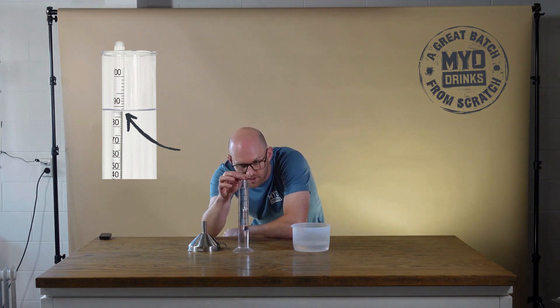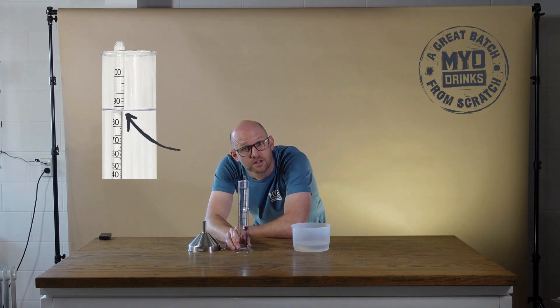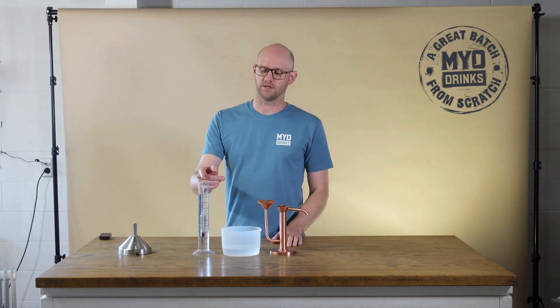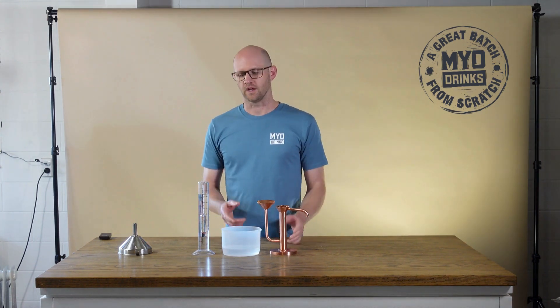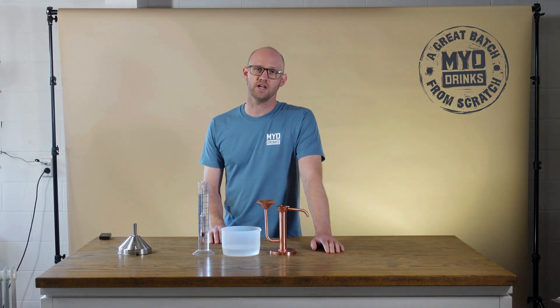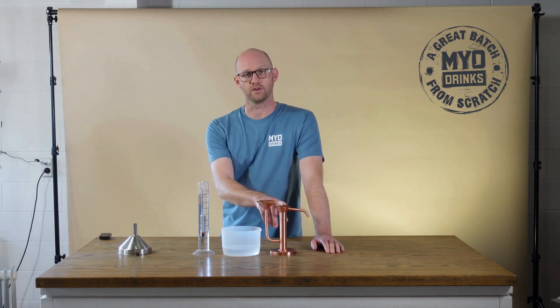For me today, I'm looking at a liquid that has 88%. A parrot head can be used in conjunction with an alcometer when you're distilling. This can be really helpful when you are pot still distilling and you're making cuts — you can get a live reading of what your ABV is coming off your still with the use of a parrot head.